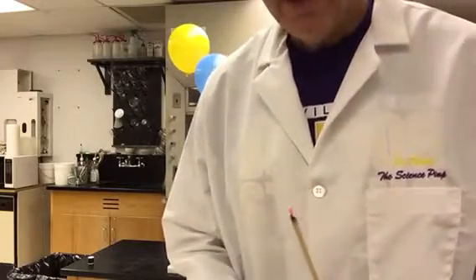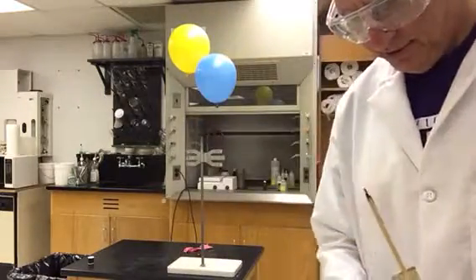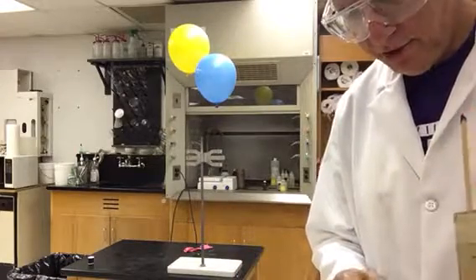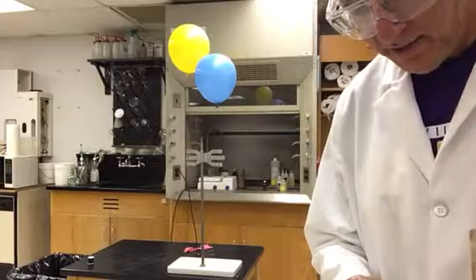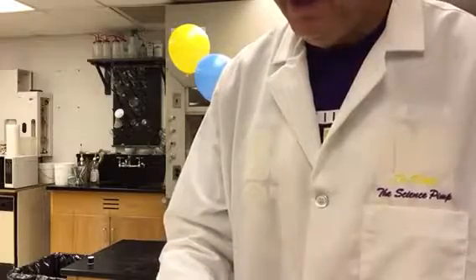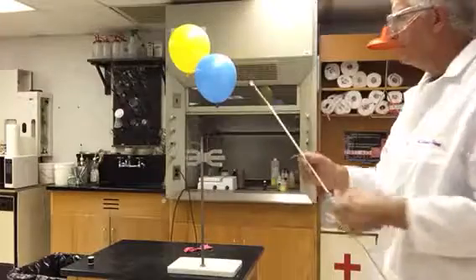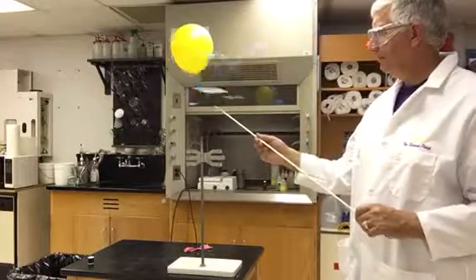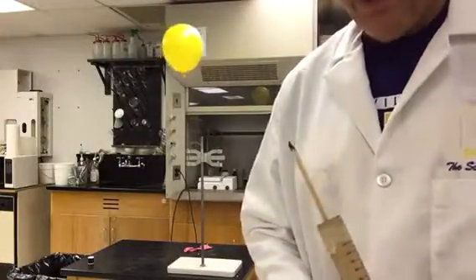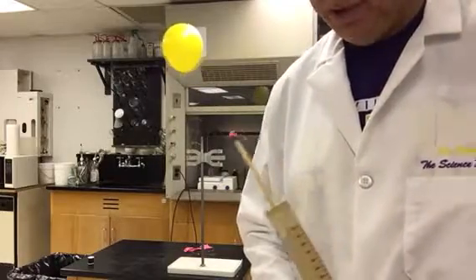Makes a normal popping noise. That's not a chemical reaction, that's actually a physical process. Pressure release, pressure wave hits you in the ear, and your ear interprets that pressure wave as a large, loud popping noise. Do the same for helium now. We'll set our helium on fire. Or will we? Again, popping noise. Slightly different tone to it, but most definitely no chemical reaction was visible there.